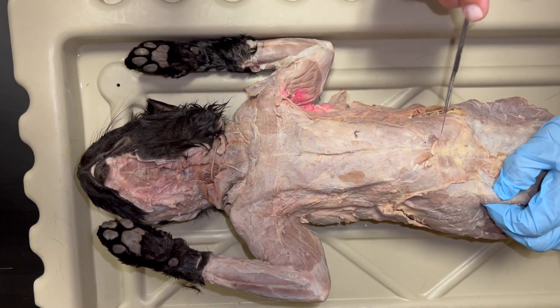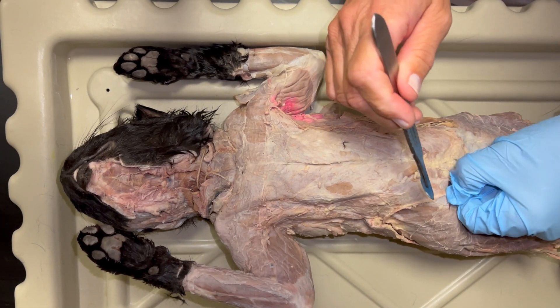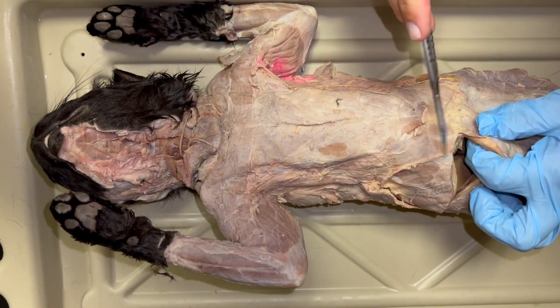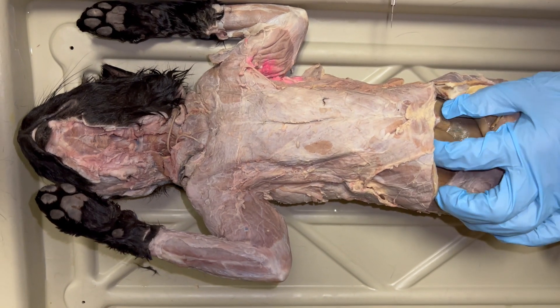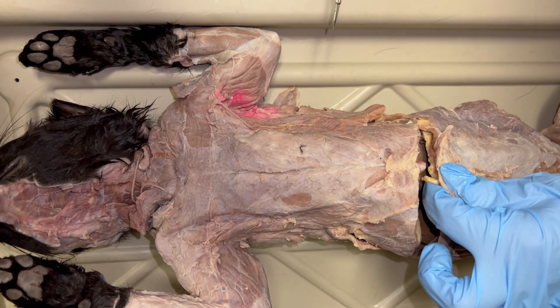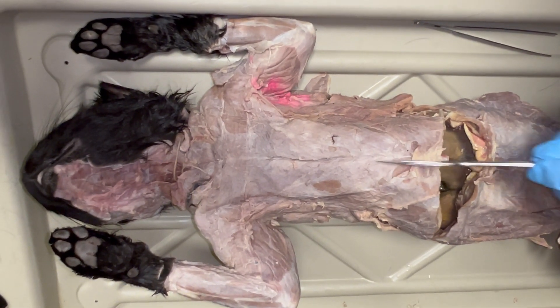Going across here, you really just want to cut all the way through until you find that you're in and there's a big space underneath. Then follow along — what we're aiming for is to cut just below the rib cage. What you'll see is stuff that's not for today, but some liver, and that's how it'll look.